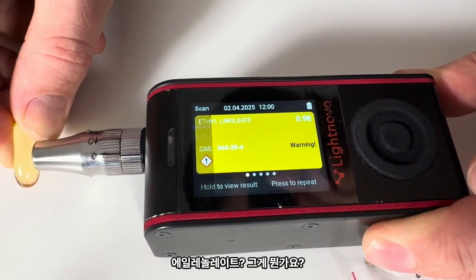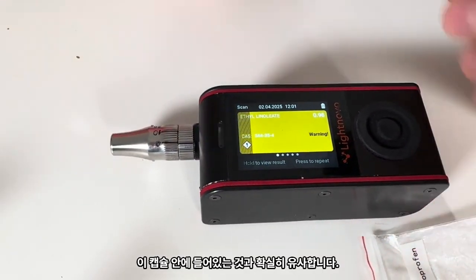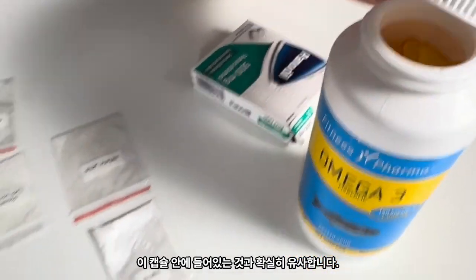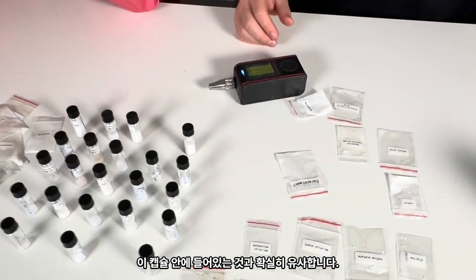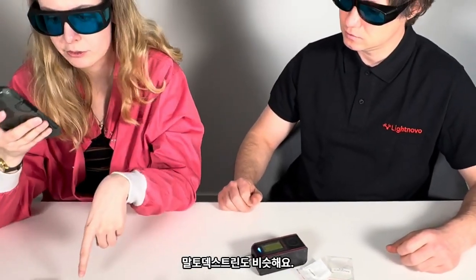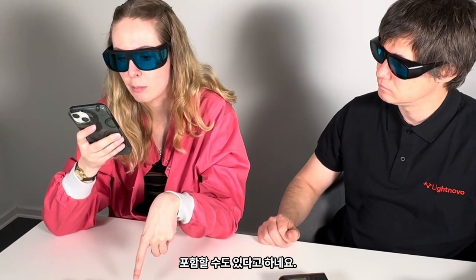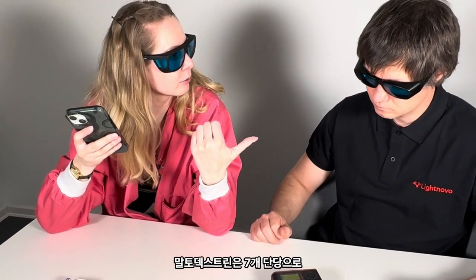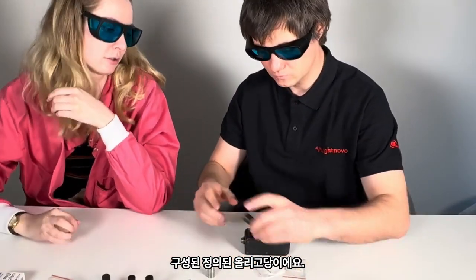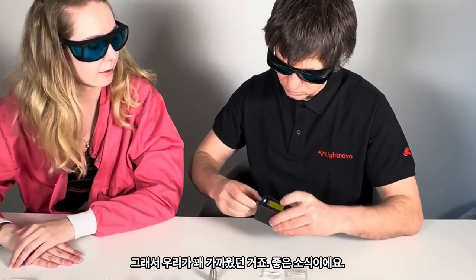Ethyl linoleate. What is that? It's some fatty acid, and it's definitely something similar to what we have inside these capsules. Good. And of course, omega-3 is a complex. Yeah, that's the same with this maltodextrin. It says that it's a mixture that may actually contain maltoheptaose, but maltoheptaose is like a defined oligosaccharide of 7 units. So we were close. And that is really good news.